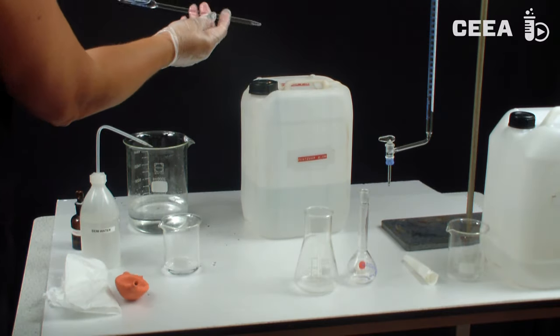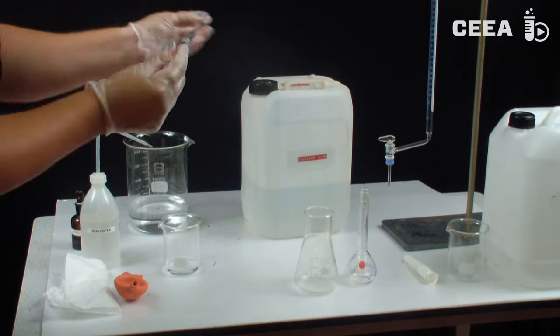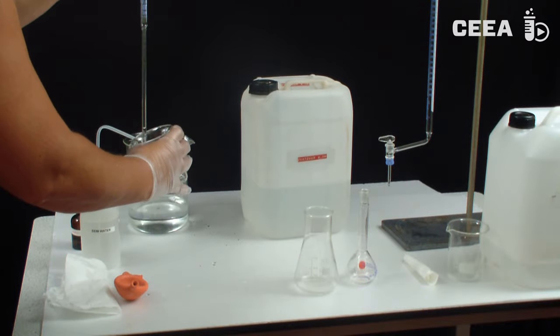Therefore, standard procedure reads 3 flushing treatments with demineralized water and 3 times with sample.